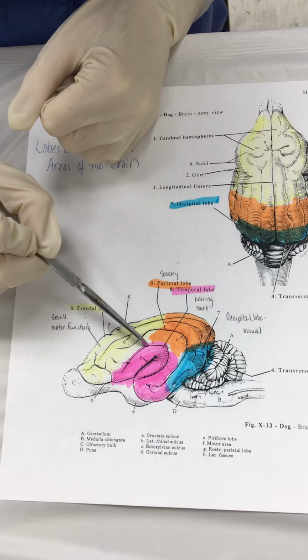We are going to be dissecting a sheep brain today. First of all, let's start off with some pictures so we can get an idea of what we're going to be looking at on our cadaver samples. This is just a general picture of a brain, just to get you oriented. This area up here will be the nose of the sheep. His tail end is more back here, the caudal aspect of the sheep.